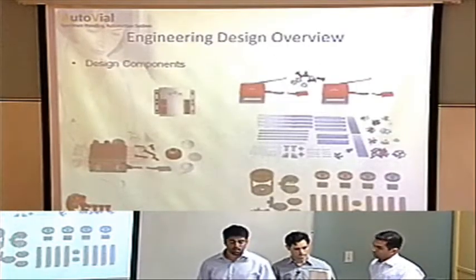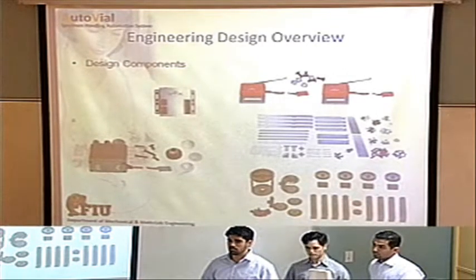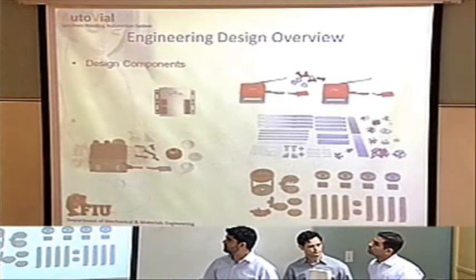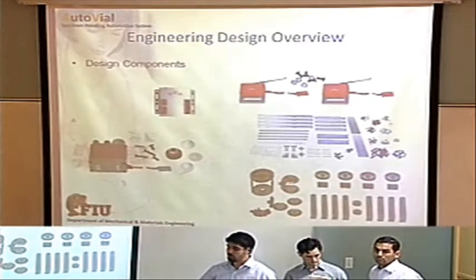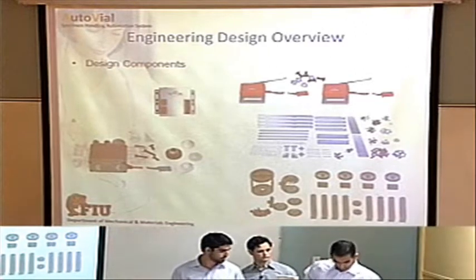Next, design components. We took all our design components basically from Vex Robotics. They had everything that we needed: all the structural pieces, the motors, the controller, and limit switches. It made the design much simpler and easier to have it all readily available online.